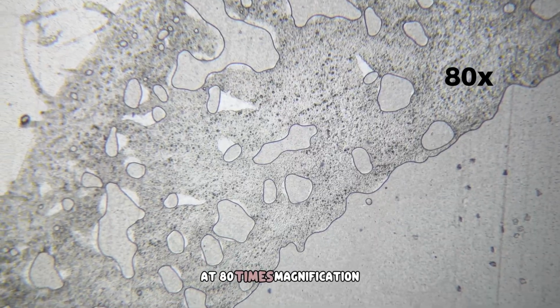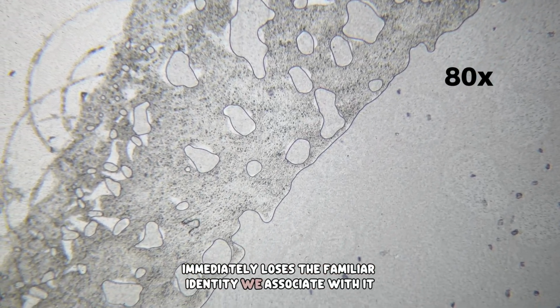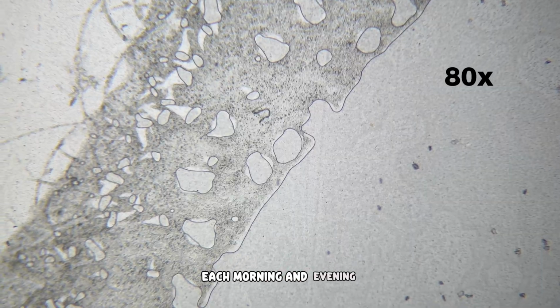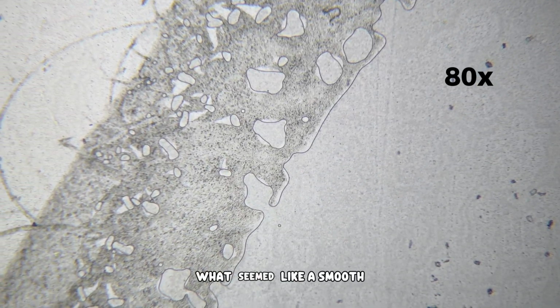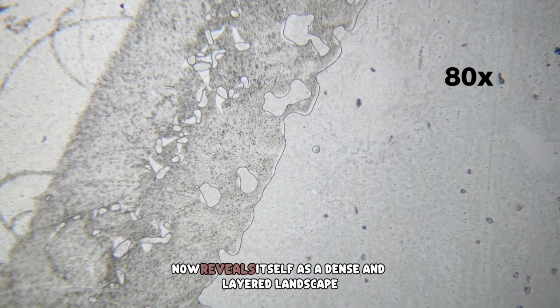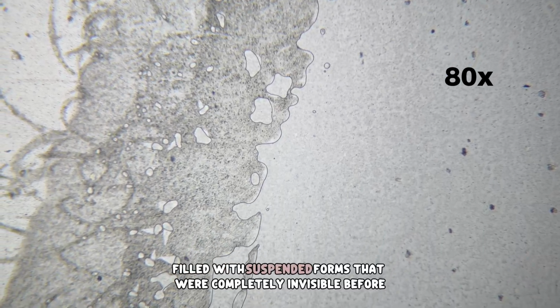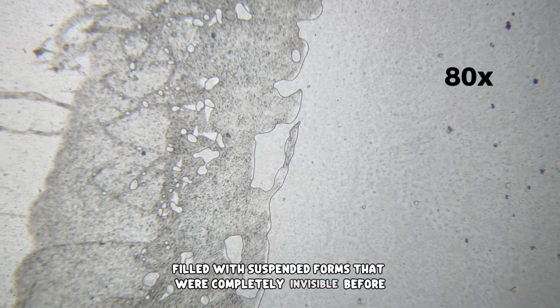At 80 times magnification, toothpaste immediately loses the familiar identity we associate with it each morning and evening. What seemed like a smooth, uniform ribbon squeezed from a tube now reveals itself as a dense and layered landscape, filled with suspended forms that were completely invisible before.